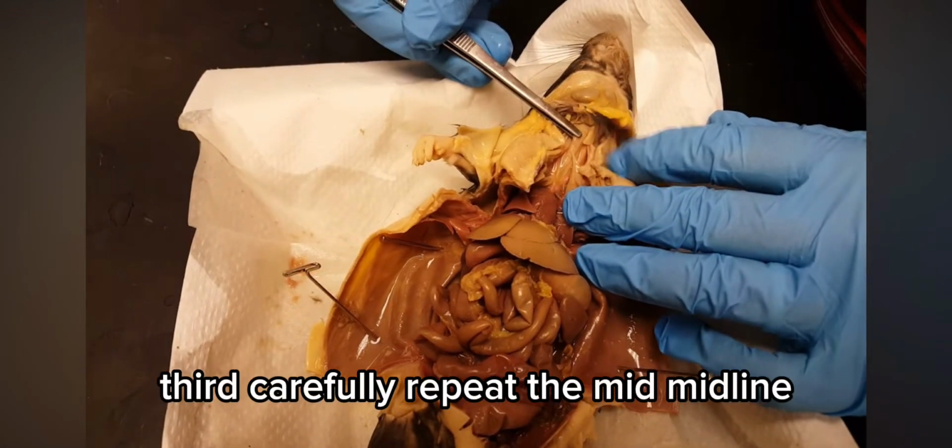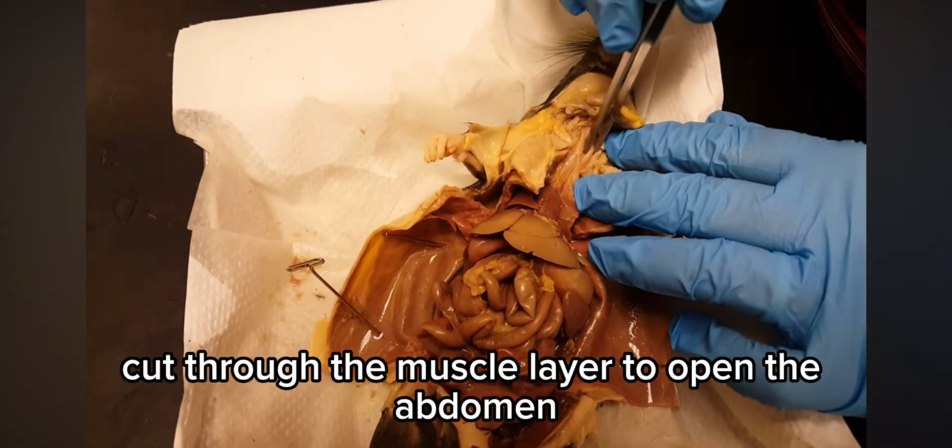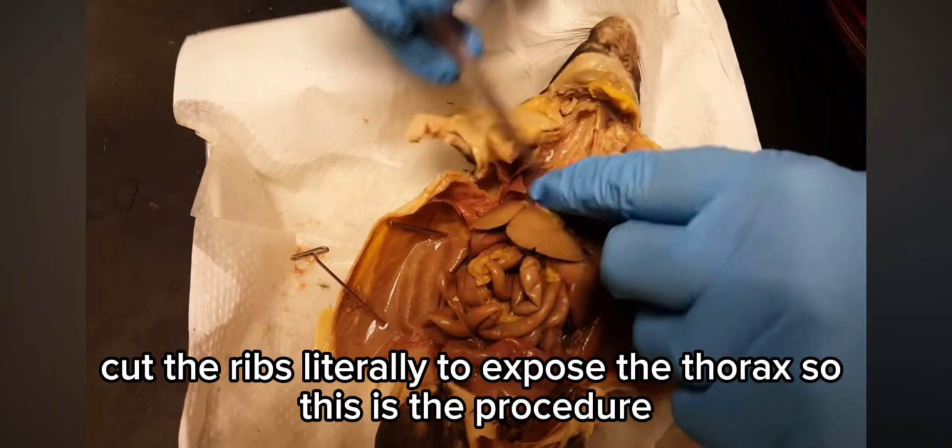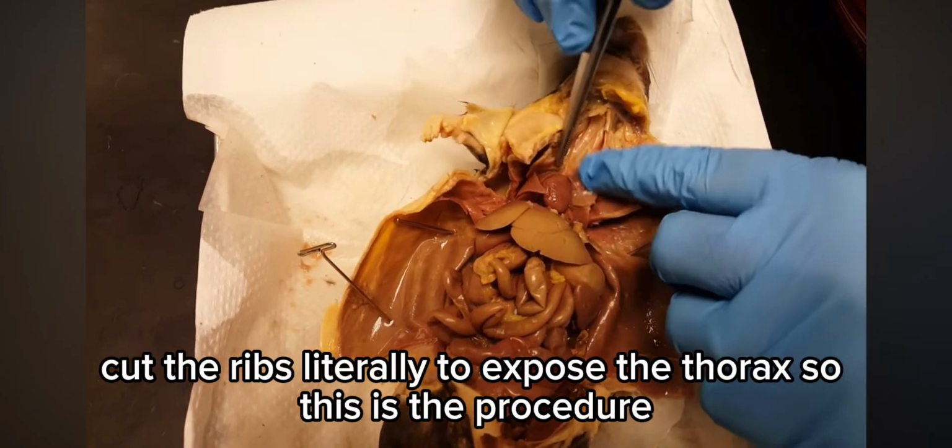Third, carefully repeat the midline cut through the muscle layer to open the abdomen. Cut the ribs laterally to expose the thorax. So this is the procedure.